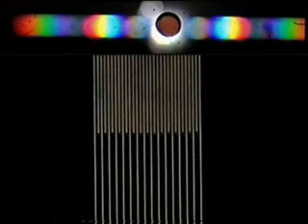There are more elaborate ways of producing a dark field image, but for the purpose of this demonstration, we're doing it illuminating with a pinhole in the first focal plane of the condenser and having what you might call an opaque pinhole in the back focal plane of the objective, which will block off the zero order light. Essentially, a dark field image is one to which the zero order light is prevented from contributing.